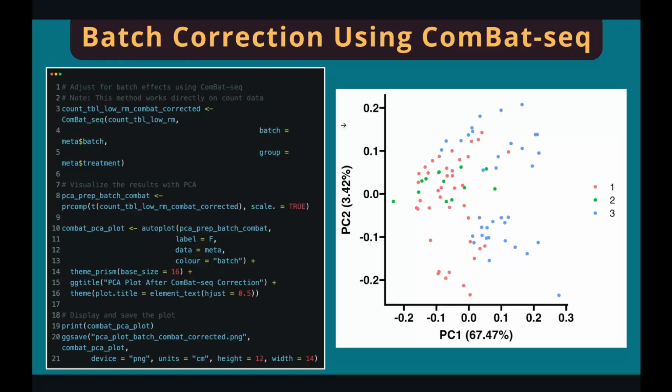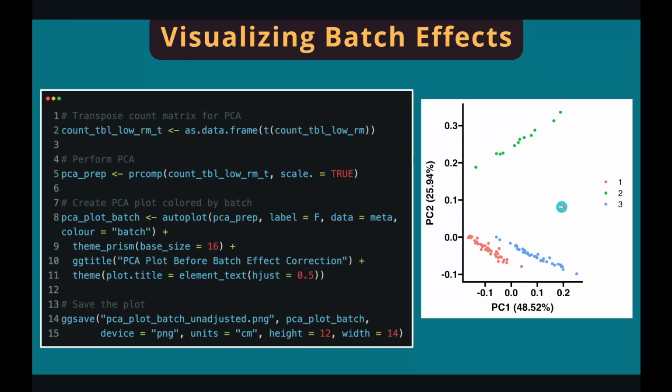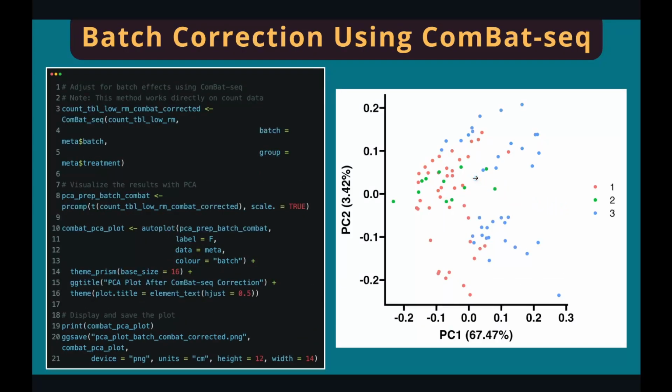I'll show you 4 different ways to remove the batch effects. Let's start with ComBat-seq from the sva package. So we're going to use the ComBat_seq function. This function accepts 3 inputs: the expression matrix, the batch information from the sample information table, and the treatment information. So the rationale is to remove the batch effects and preserve the treatment information. The function will return another gene expression matrix in the same format, but with different values. And then we'll make another PCA plot to visualize the results. As you can see, the samples from different batches are mixed together much better than before. So that means we have removed a lot of batch effects from our data.